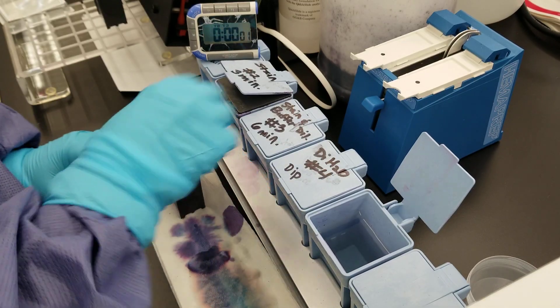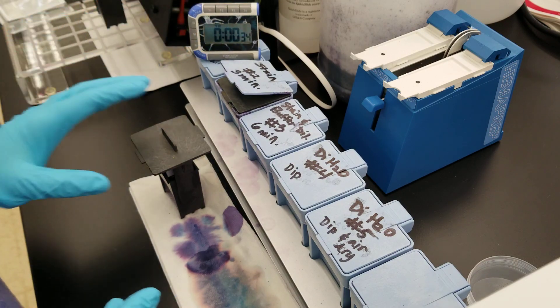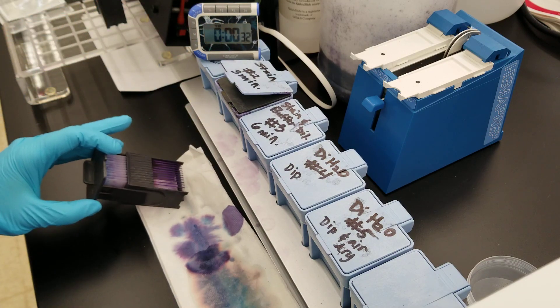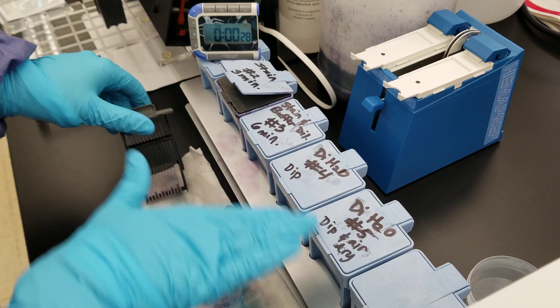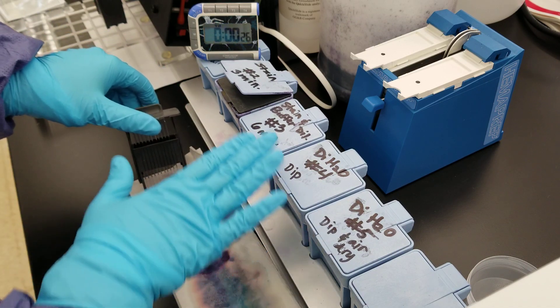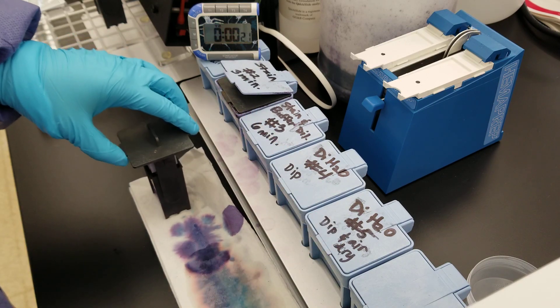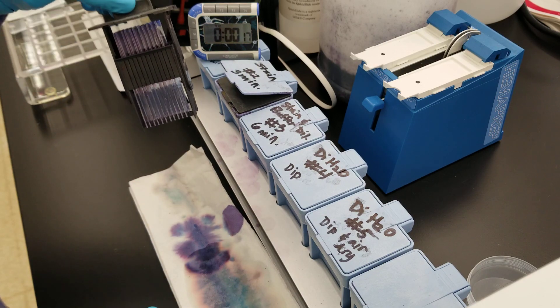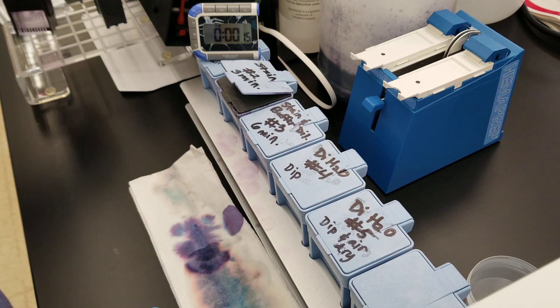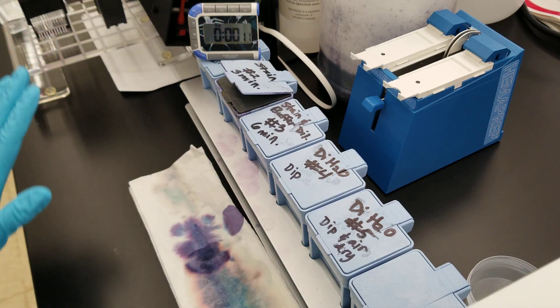At the beginning of every semester I go through and make sure that the stain is nice and new so that you'll have a great experience and see wonderful morphology on your slides. These are all replaced. I actually cleaned out most of these chambers before putting more stain in there. This is going to air dry. The other one's in the process of air drying too to go through these steps, but you're not going to watch that one.